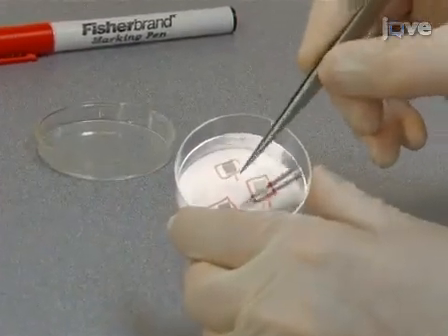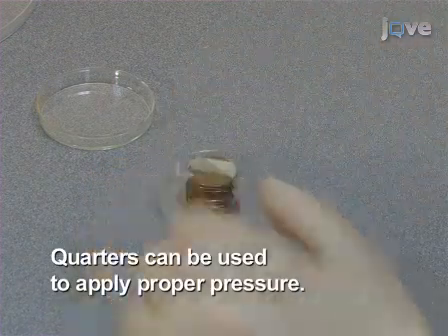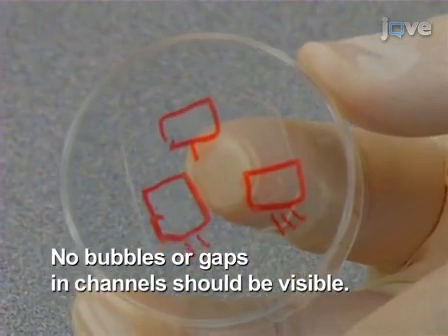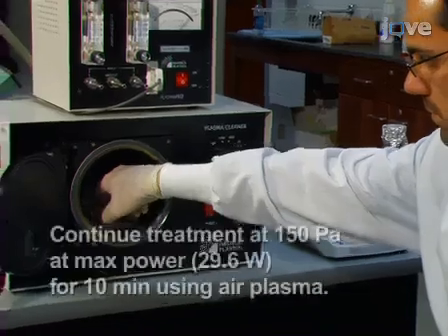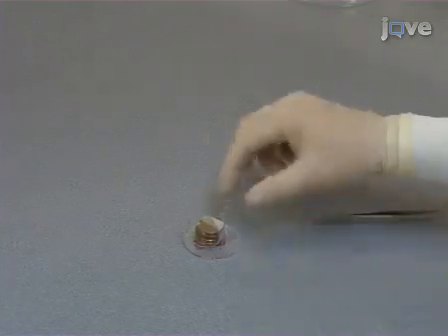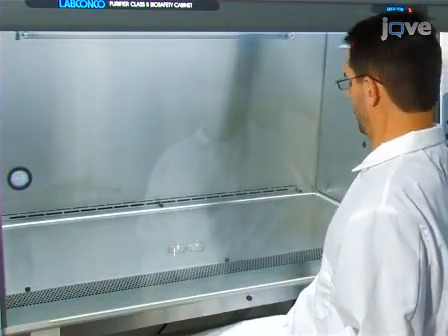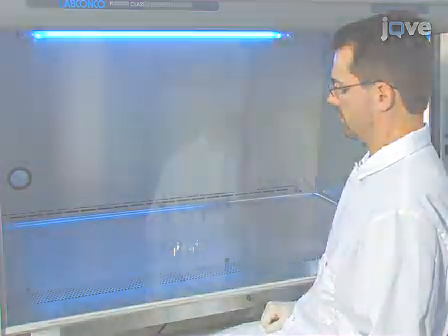Form a tripod from the sections and weight the tripod to ensure conformal contact between the working mold and the petri dish surface. Look at the bottom of the dish to confirm good placement, as evidenced by the presence of channels that can be seen by the naked eye or with a small magnifying lens. Place the assembly into a plasma chamber. Initiate plasma treatment. After the plasma treatment, remove the mold and weight arrangement and place the petri dish inside a biosafety cabinet under UV light for 10 minutes for sterilization. Store the dish there until it is seeded with cells.